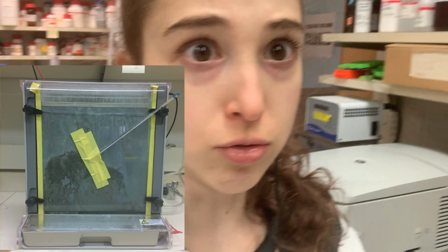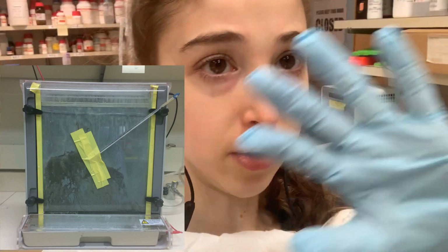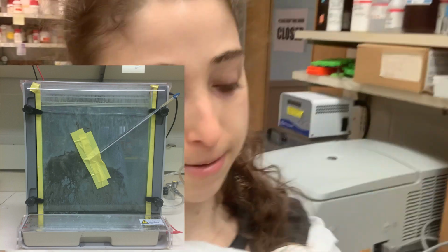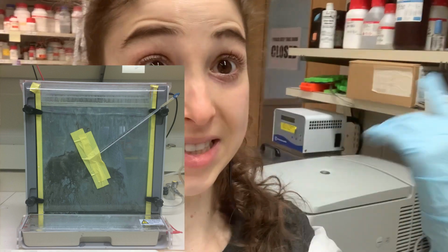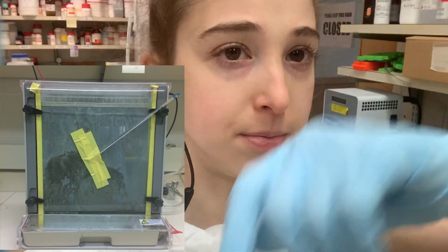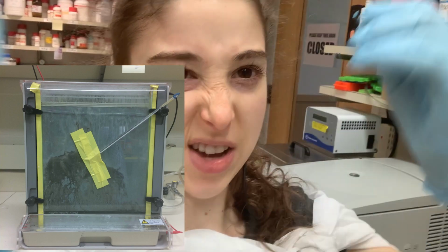For some types of gels, you really need to avoid bubbles, like if you're doing sequencing gels, like urea gels, those really big ones that are really thin. In those cases, you can degas it, where you have basically a filter device, and you're spinning it and getting out any bubbles.